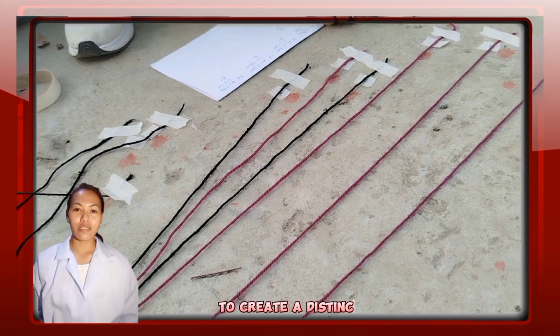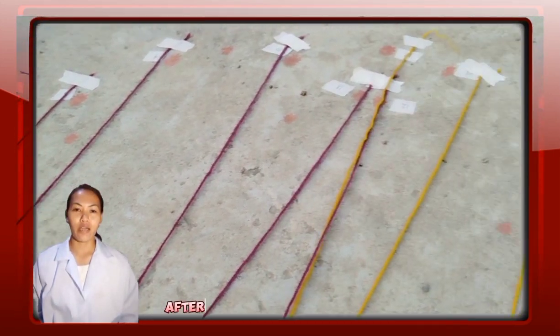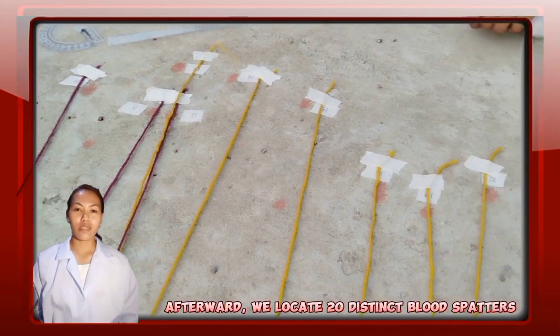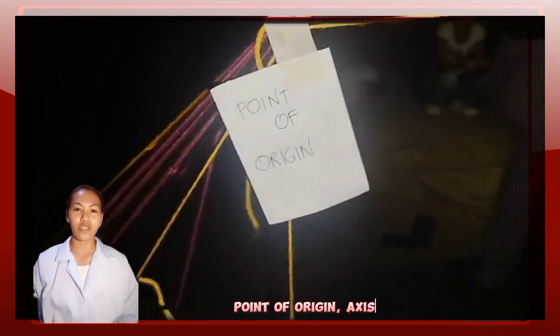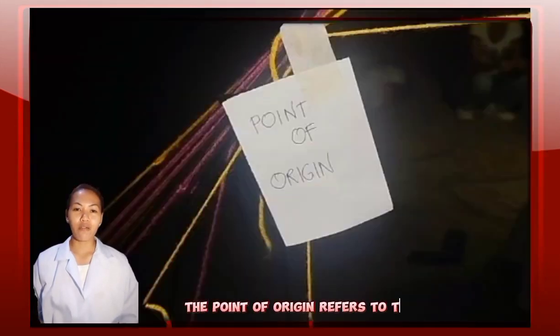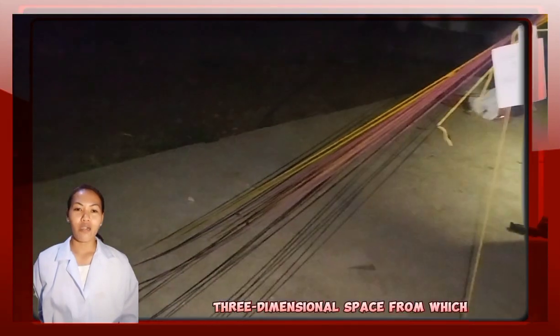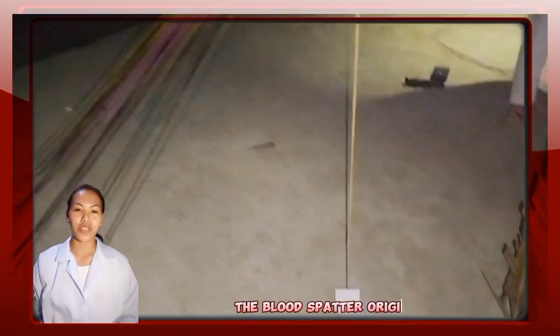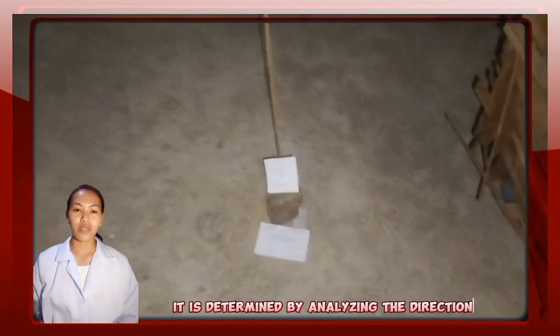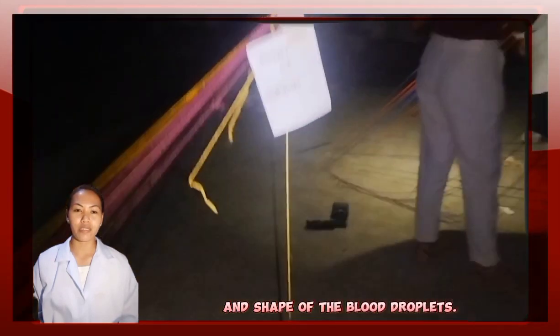To create a distinct blood spatter, we release blood using a spatula. Afterward, we locate 20 distinct blood spatters and proceed to identify their point of origin, axis of origin, and area of convergence. The point of origin refers to the location in three-dimensional space from which the blood spatter originated. It is determined by analyzing the directionality and shape of the blood droplets.